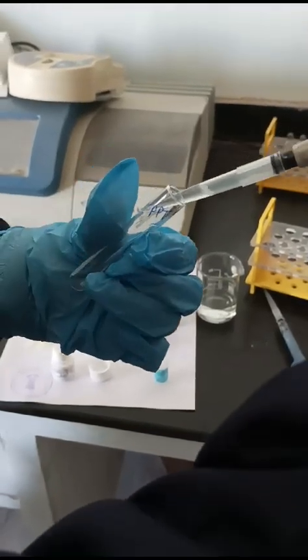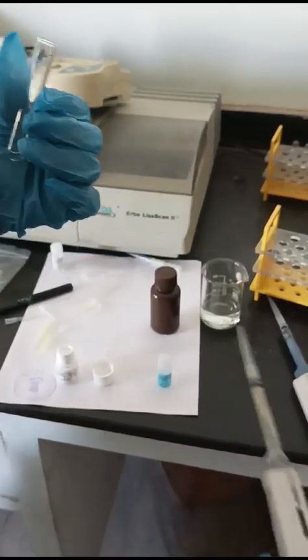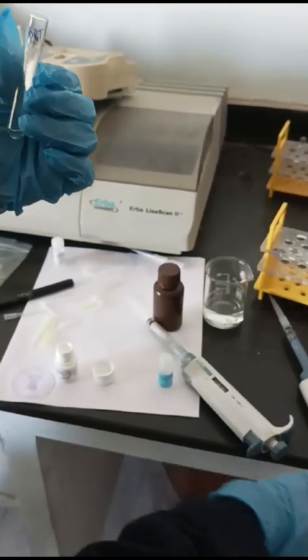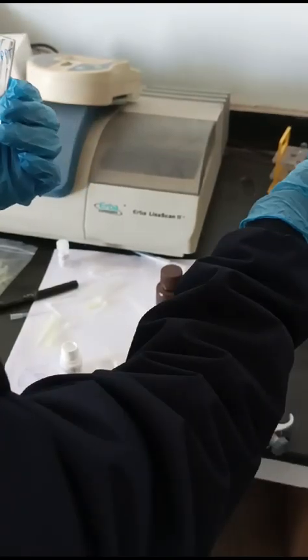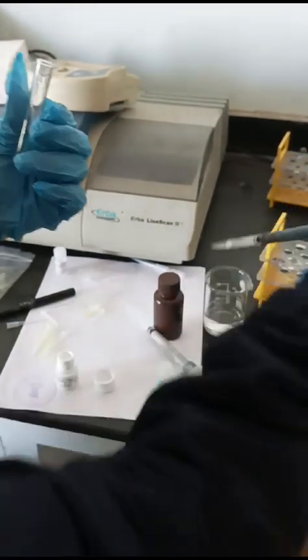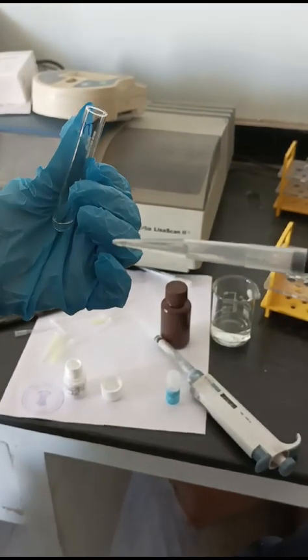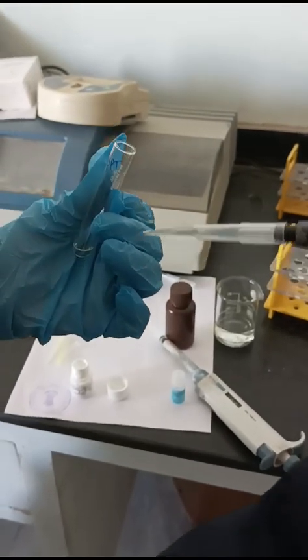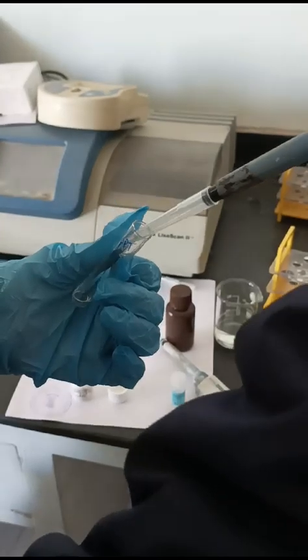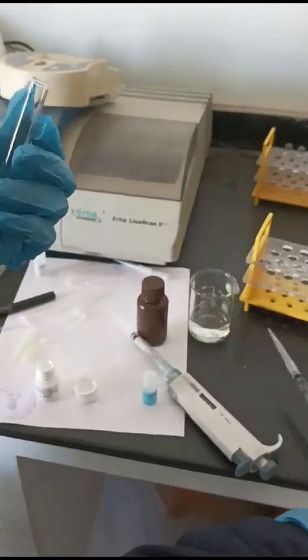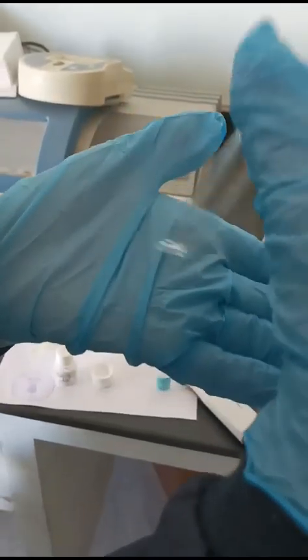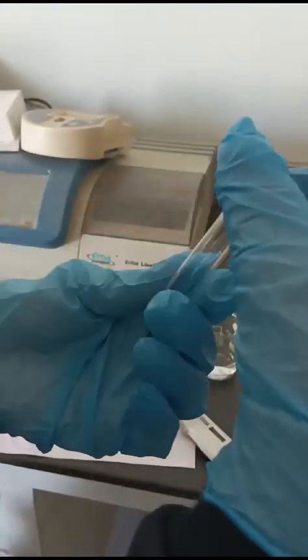This is the serum, 200 microliters, and all together it will make up 500 microliters. This is the extra step involved for precipitation.